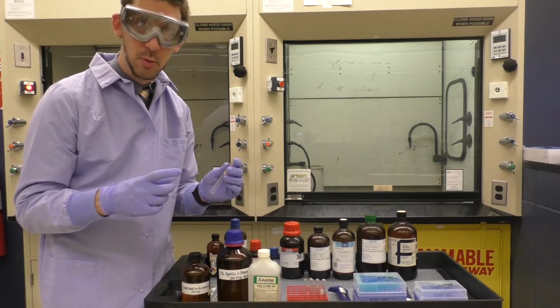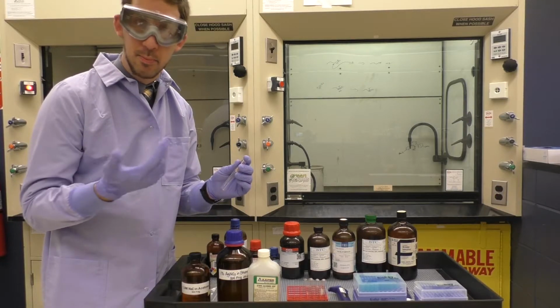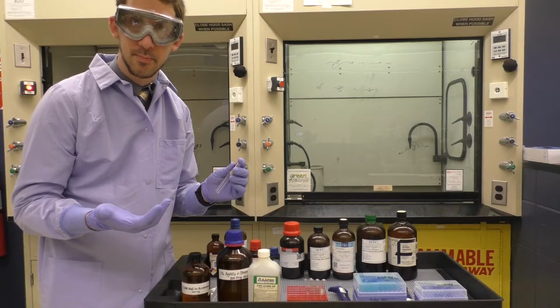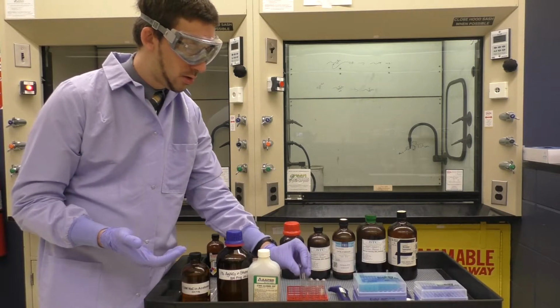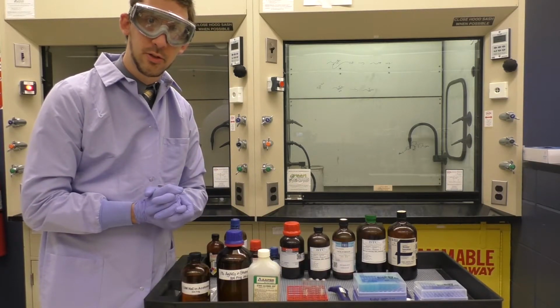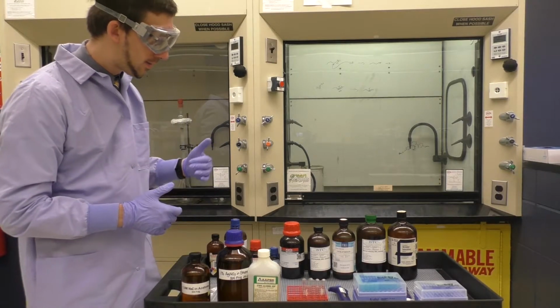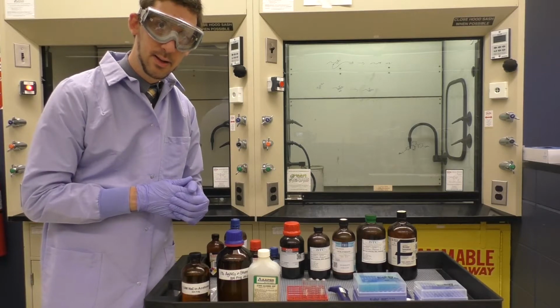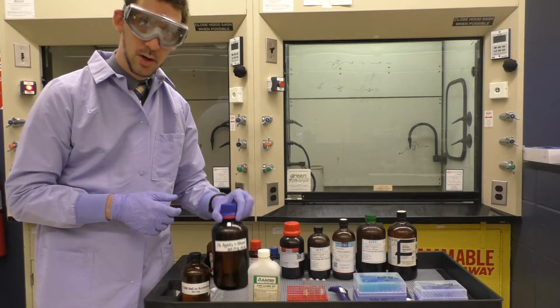Or for some of these, we will see that maybe no precipitate, maybe no reaction will occur within a 5-minute span. And so this will allow us to compare reaction rates across 10 different substrates. We'll do this 10 different times in 10 different test tubes for the SN1.